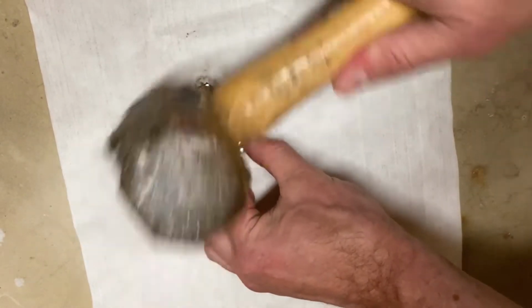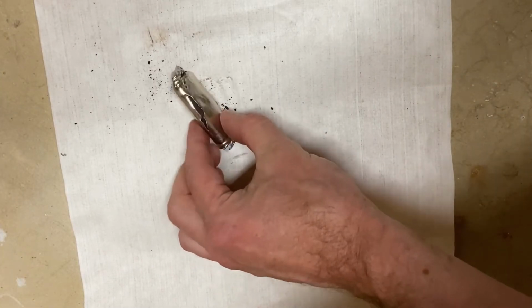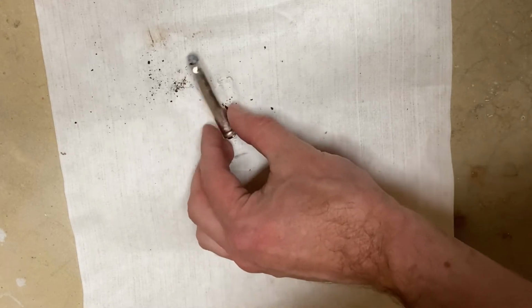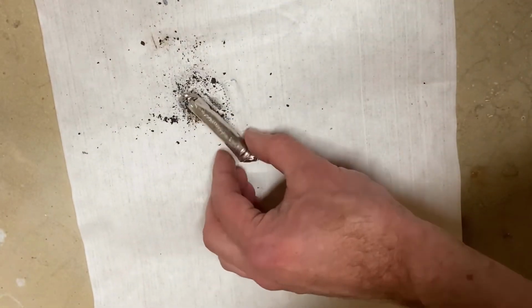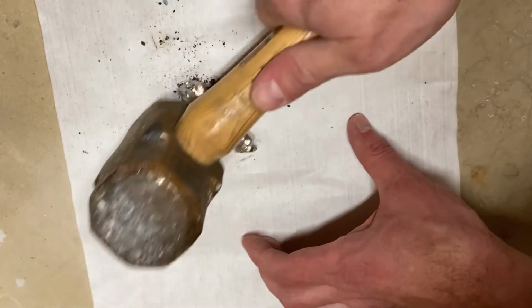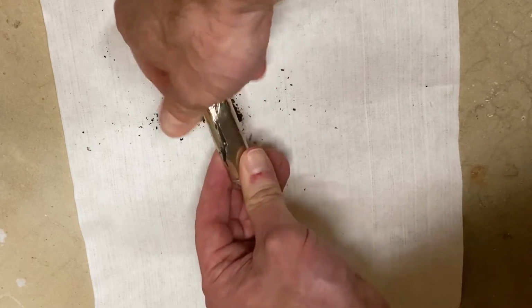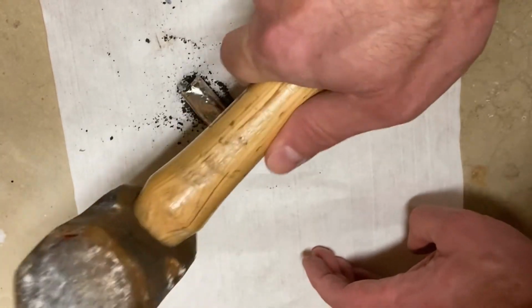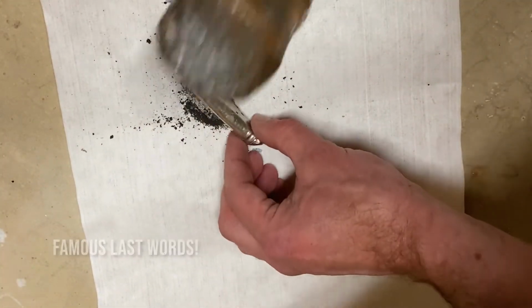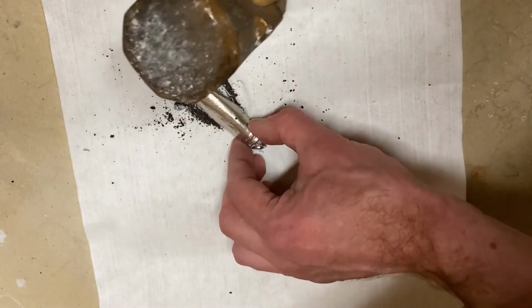That seems to be, aside from making random bits of stuff fly out. There we go. That's starting to look good. All right, you can actually see even a little bit of the zinc oxide that's getting squeezed out. So I don't really need to be that careful about dividing up the manganese oxide and the zinc oxide in there, because I'm going to use some differences in solubility to get them extracted.